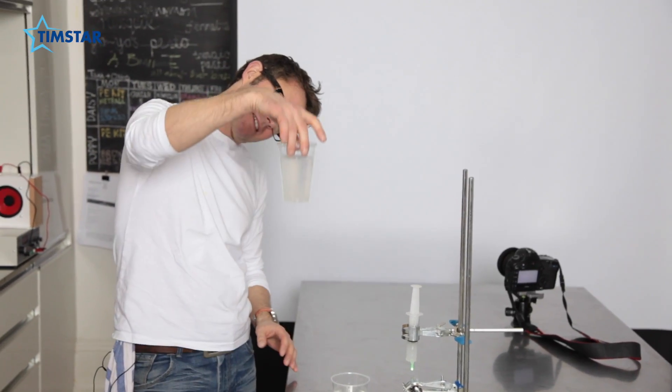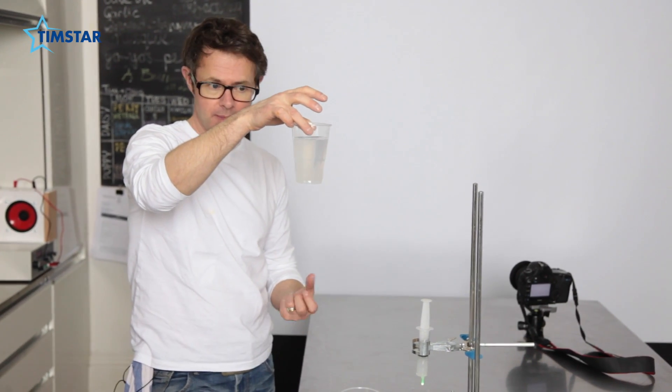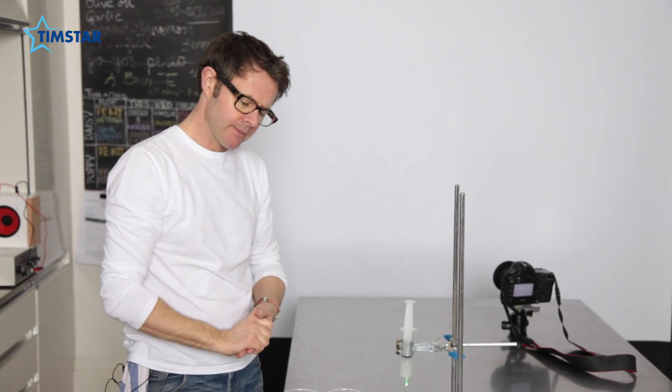Now this is a very, very weak solution. So there's a tiny couple of little grains of yeast in quite a lot of water. This little murky glass has about four droplets of milk in it. So it's milk in a very, very heavy solution of water.